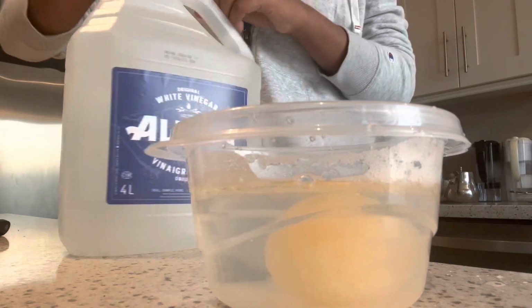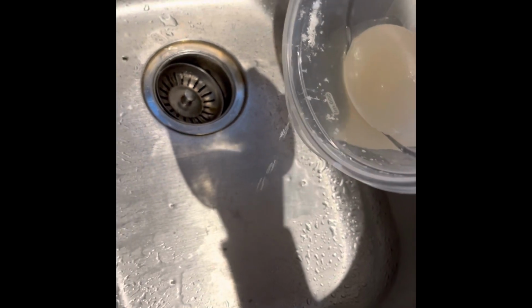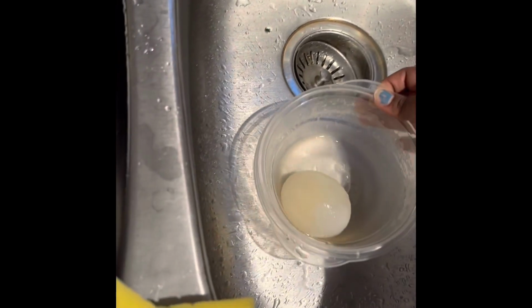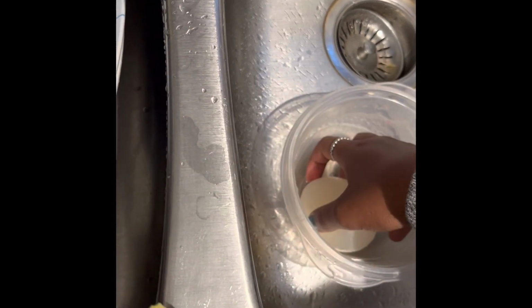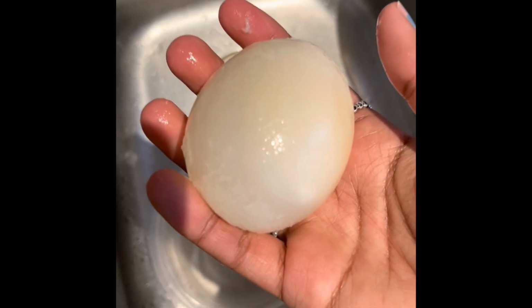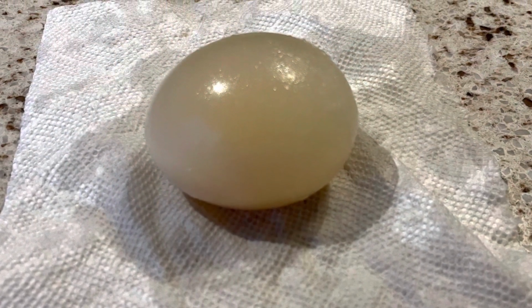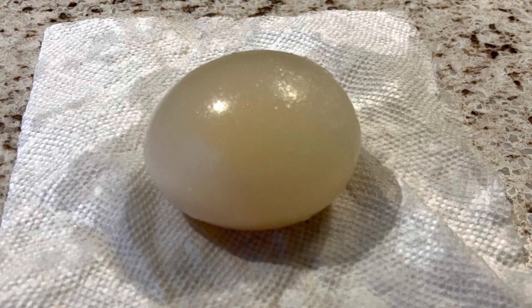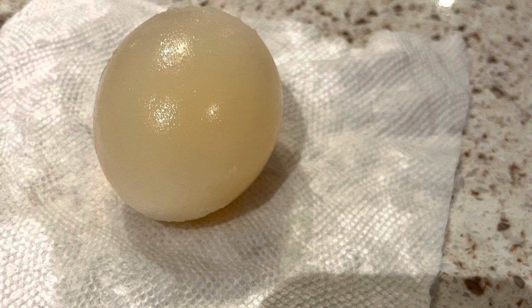Throughout the hours, Egna began to bubble in the vinegar and the shell started to dissolve, leaving a foamy white residue in the solution. After 48 hours, I had my naked egg. It was jelly-like and had a semi-transparent appearance. I rinsed Egna and let her dry on a paper towel as I cleaned my container for the syrup. I used maple syrup and covered Egna completely in it, and during this step, I calculated my time correctly so that my egg could sit in the syrup for a full 48 hours.